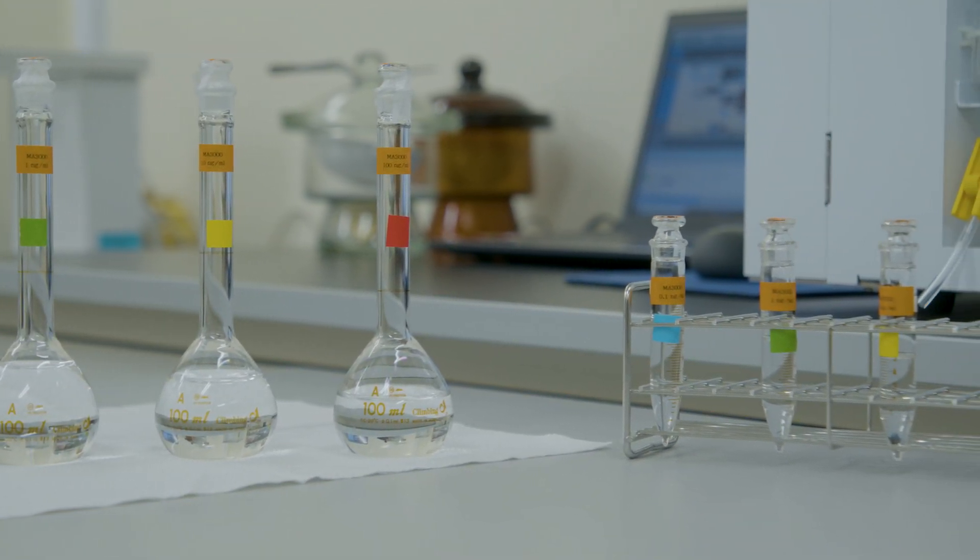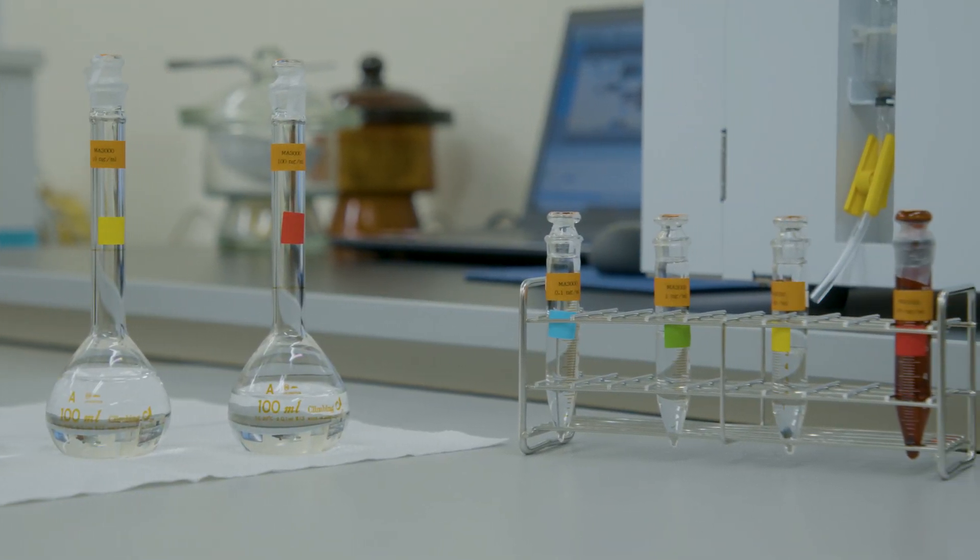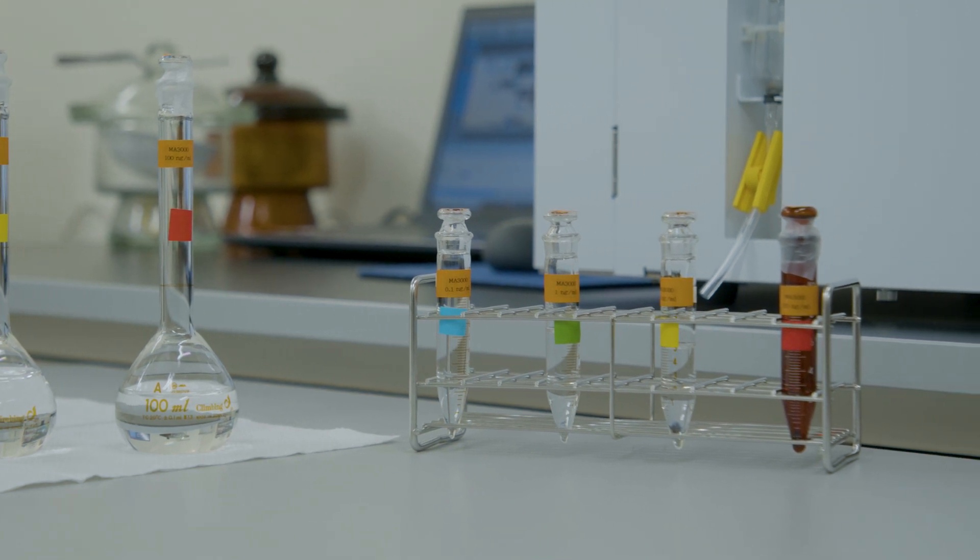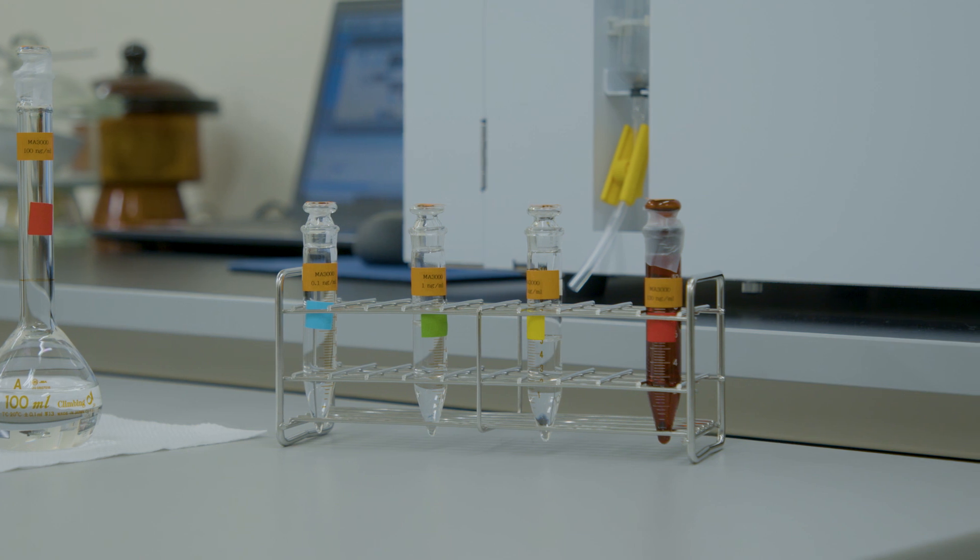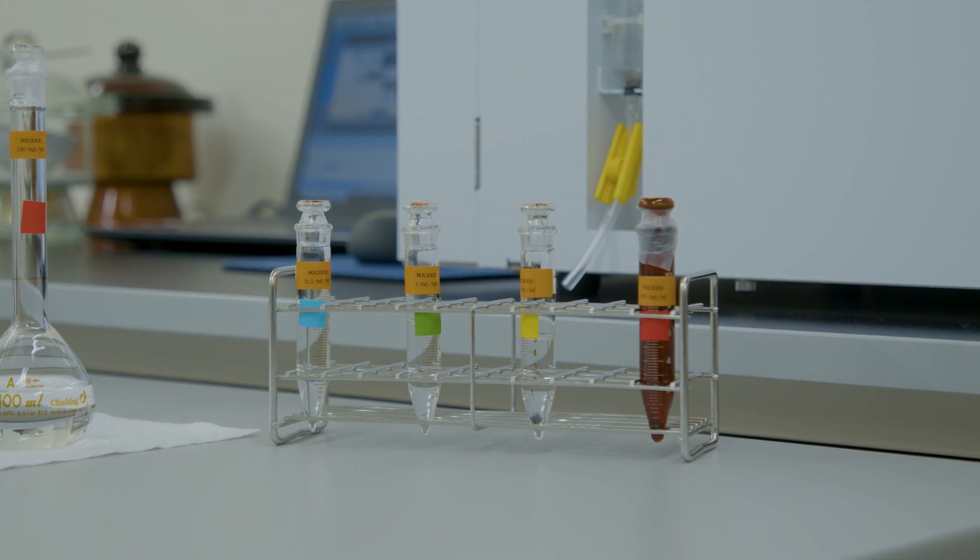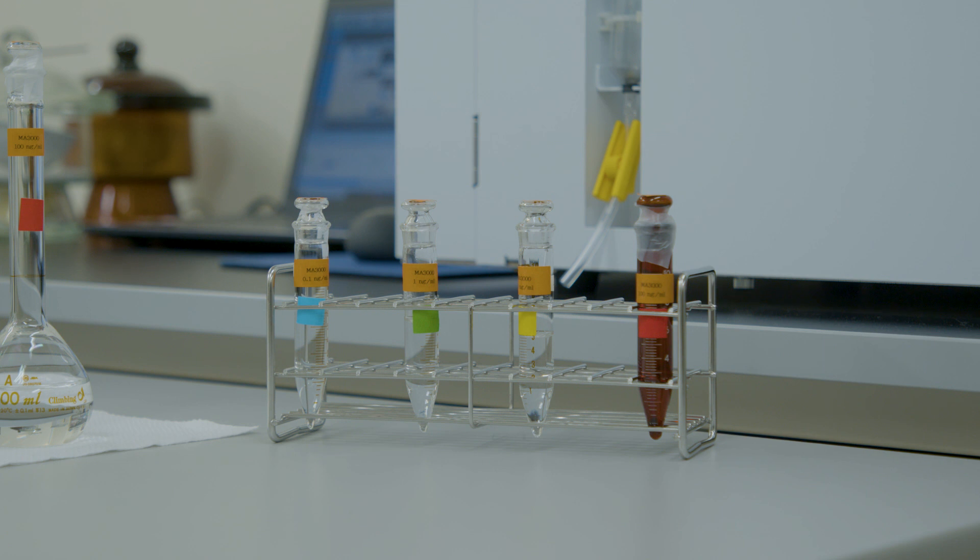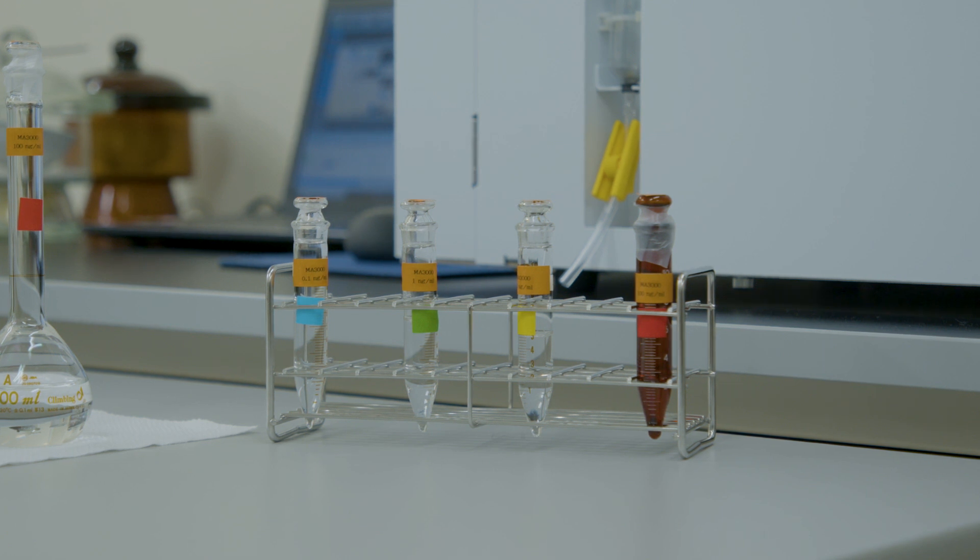To ensure consistency, we can prepare working standard solutions at four concentrations by using nitric acid and L-cysteine. These solutions last for one year when stored in glass flasks in a refrigerator. However, it is a good idea to check their stability under laboratory conditions.